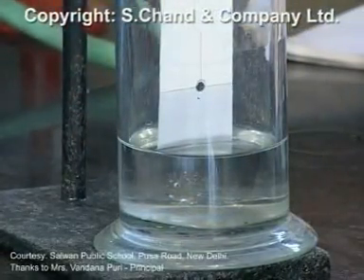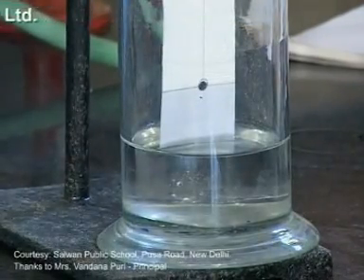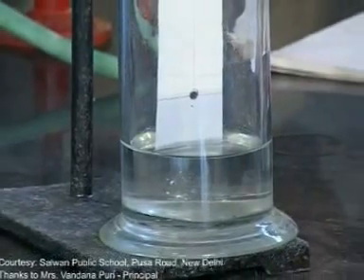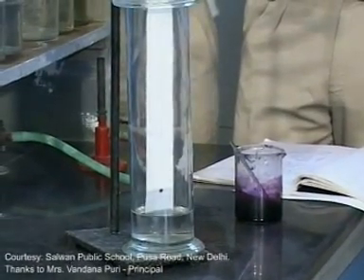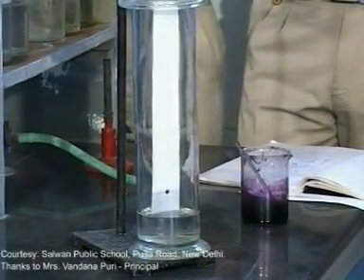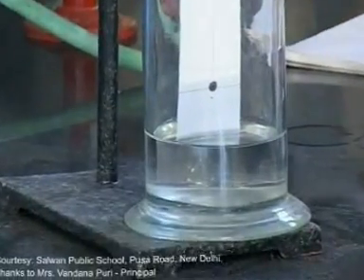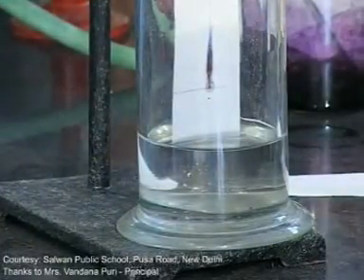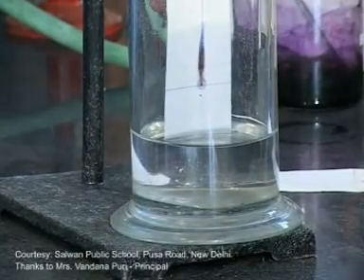You can see the water is rising up along with the red and blue ink. After some time — say after 10 minutes, when the water level has risen appreciably 15 to 20 centimeters — the two inks, blue and red, will separate out at different heights. Can we use any other solvent than water? Yes, definitely we can use other solvents like ethyl alcohol, ethanol, or even vinegar. Already 5 minutes have passed and you can see the solvent rising up along with the red and blue ink.